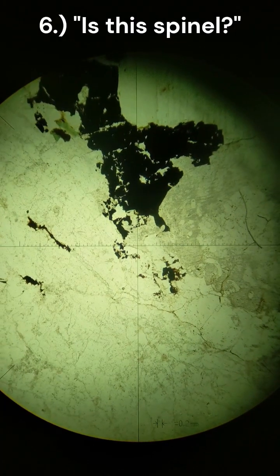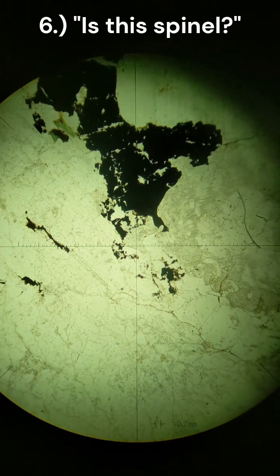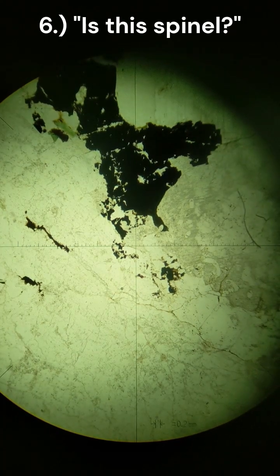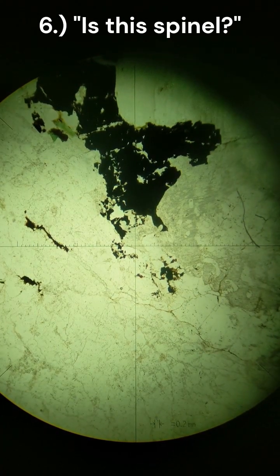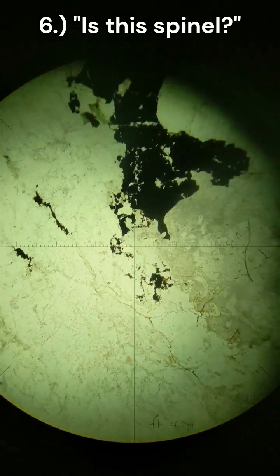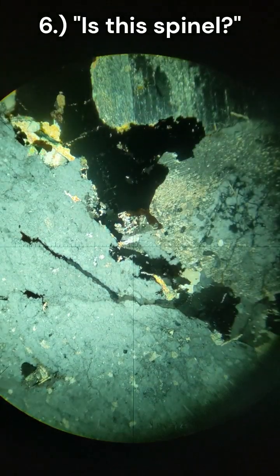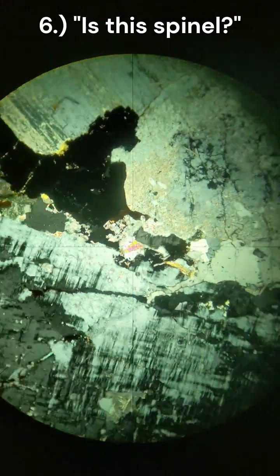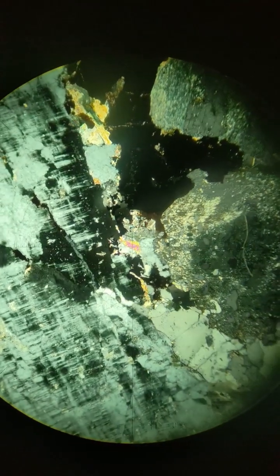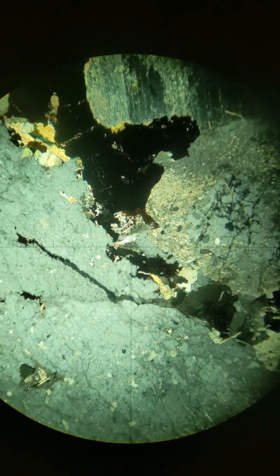This is slide 95 again, centered in the middle of the crosshairs here on 4 times magnification. Believe the stuff on the upper is spinel, anhedral, black blob, no extinction. Putting it on crossed polars, same thing with spinel, but more weirded out by the thing that is in the crosshairs, going to 63 magnification now.